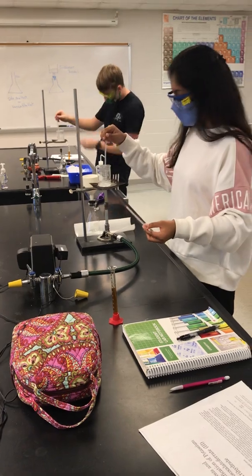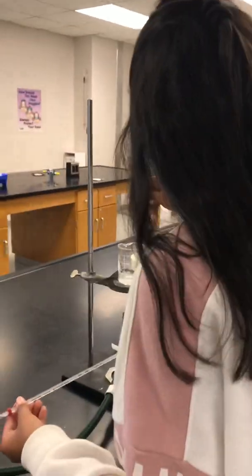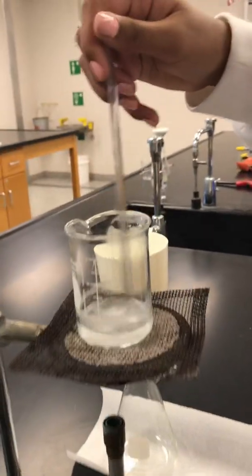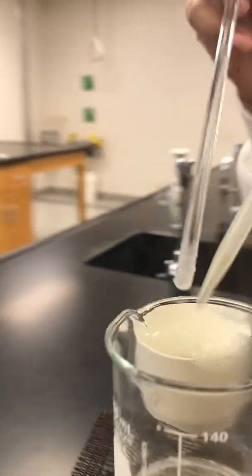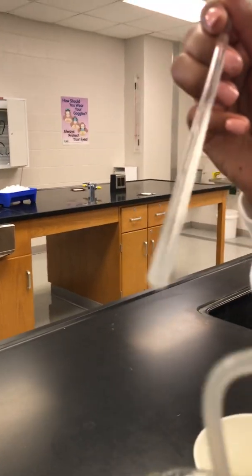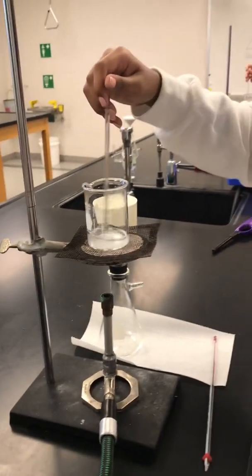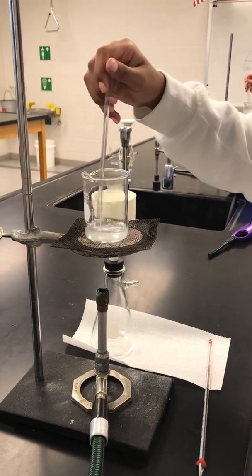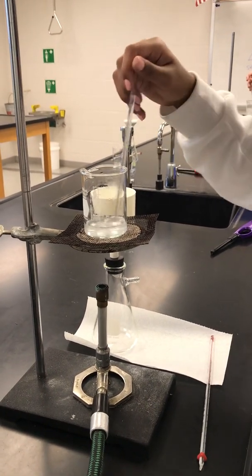What do I pour in — the 8 milliliters? You want it once it's all dissolved. Now it's kind of sticking up around the sides. See how it's kind of sticking up around the side? It does not want to dissolve, so I'm just going to add just a little bit more water. Because the 20 milliliters isn't necessarily 20 milliliters based upon the beaker — the beaker is the least accurate way to measure volume. Now it looks like it's pretty much dissolved. There's just a little bit left.